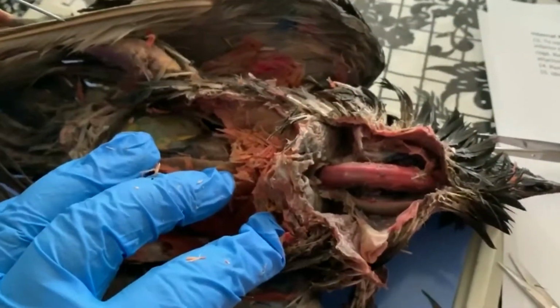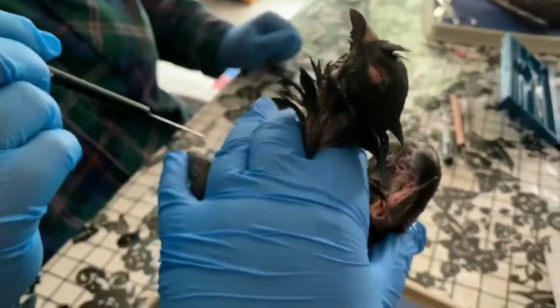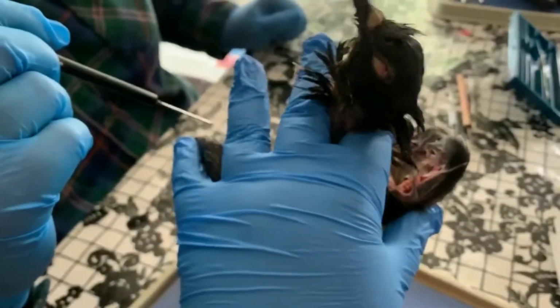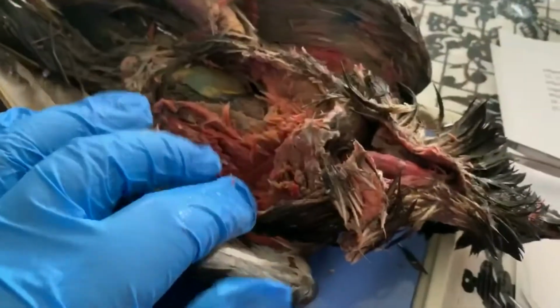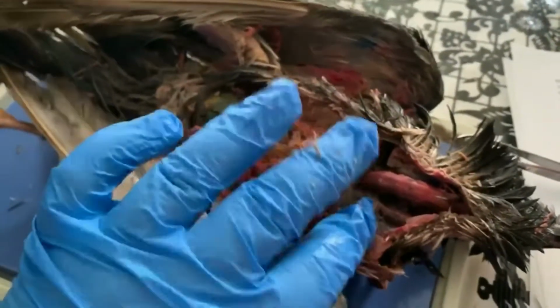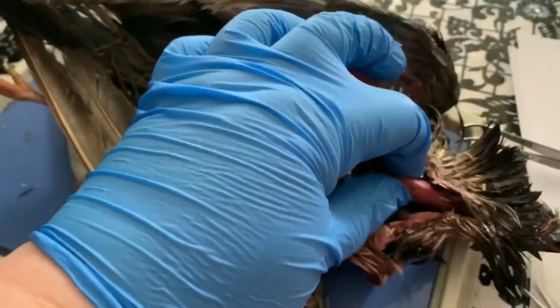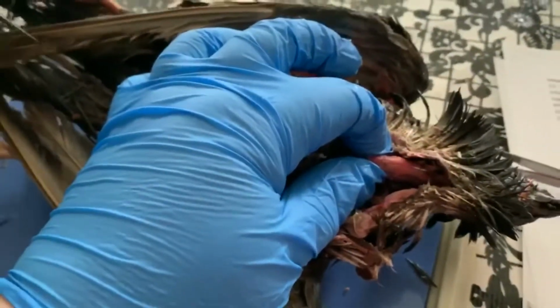Anyway, if you're going to catch a bird, you're going to hold it by its neck. You're basically going to put the bird, this is going to look horrible because this bird is open, but you're going to catch the bird and hold its body in the palm of your hand, and you are going to squeeze really, really hard on its neck. Because if you don't, you're not going to be able to keep that bird and hold on to it. It will be able to work its way out of your grip. You can't crush this, all right? The trachea is an incredibly durable structure in birds.